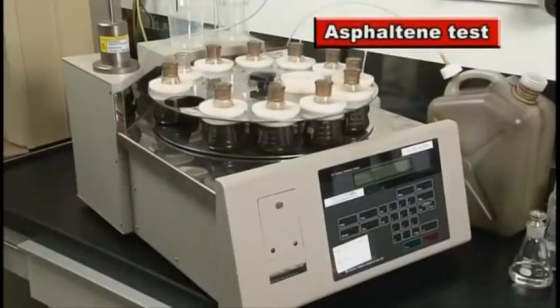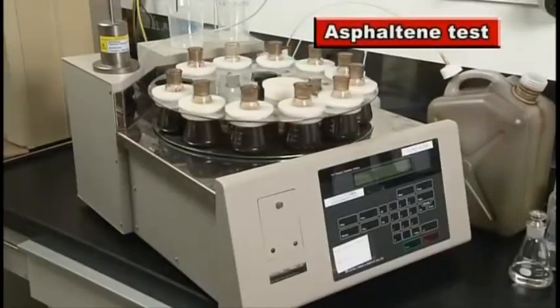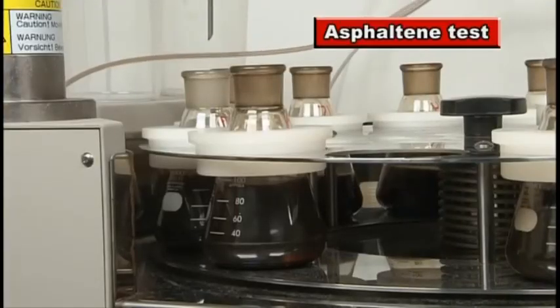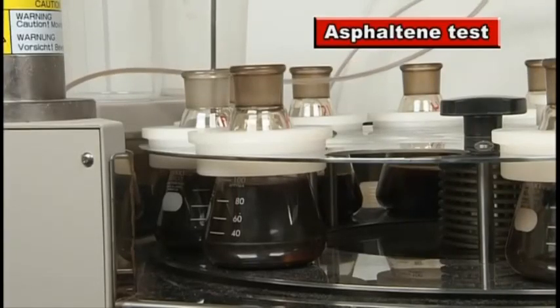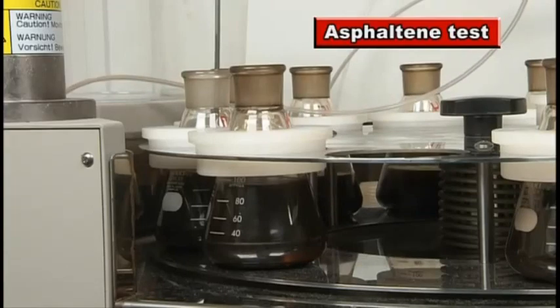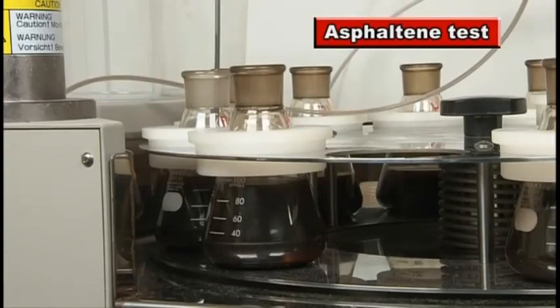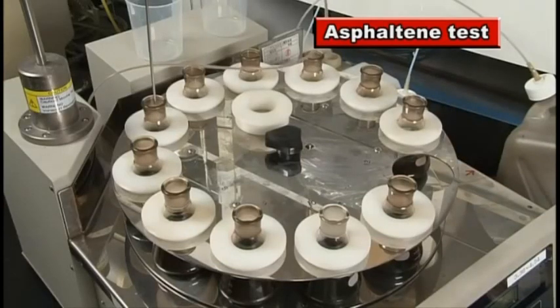An asphaltene test is an important test that clarifies fuel oil properties. Asphaltenes are flame retardant substances that cause combustion problems due to delayed ignition and breakdown of the cylinder oil film.